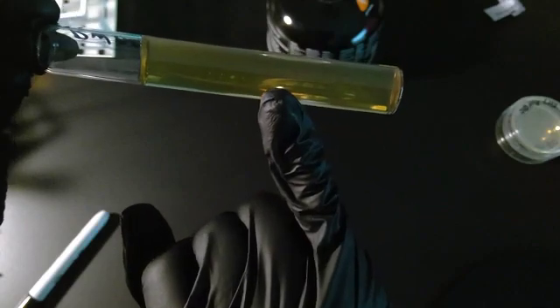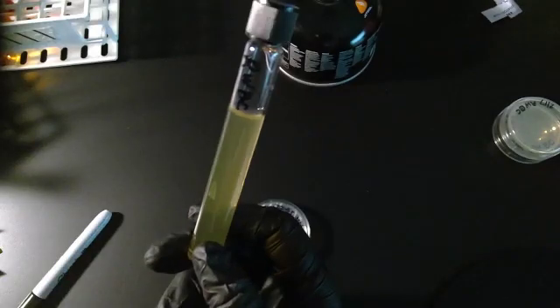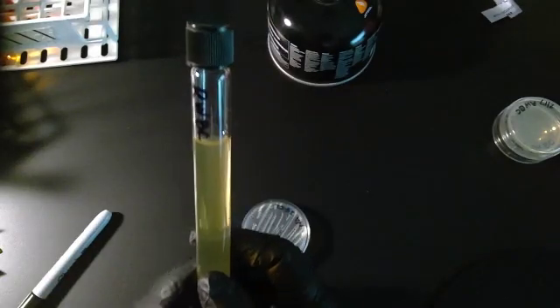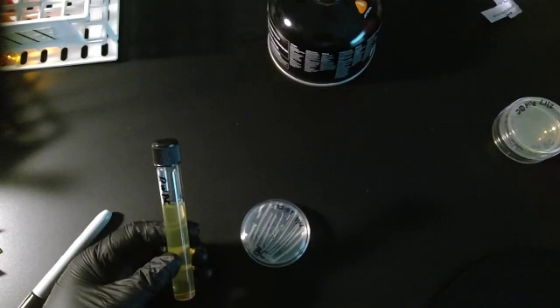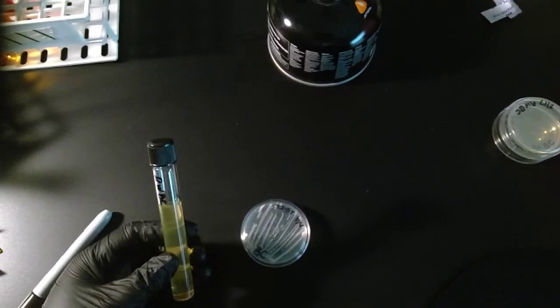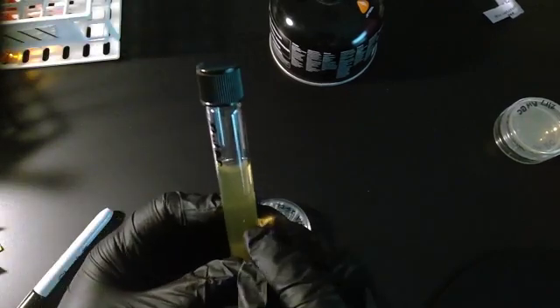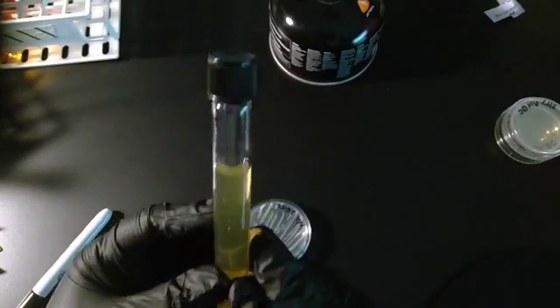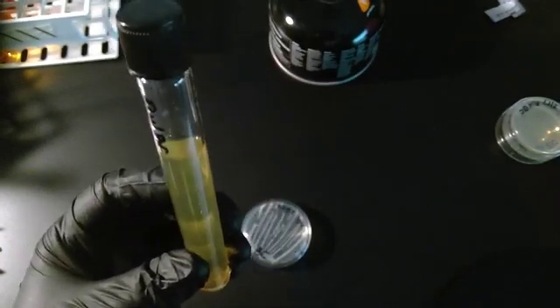You can also see that it's not necessarily the straightest stab ever. But when the Bacillus cereus grows, we're going to see if the Bacillus cereus is motile, if it's moving, because it will be beyond where we stabbed. If it doesn't, it'll stay right there in that stab wound that we've created.